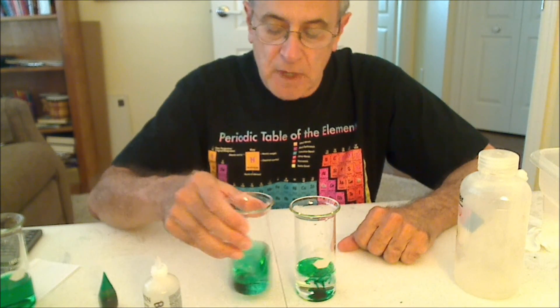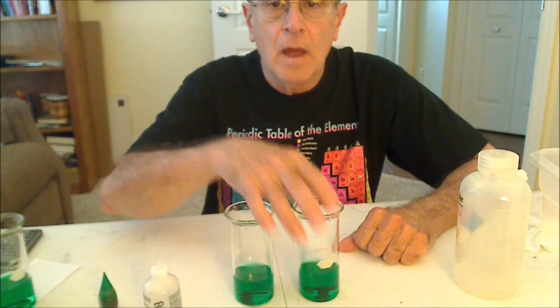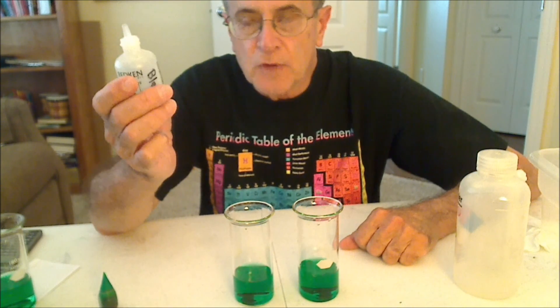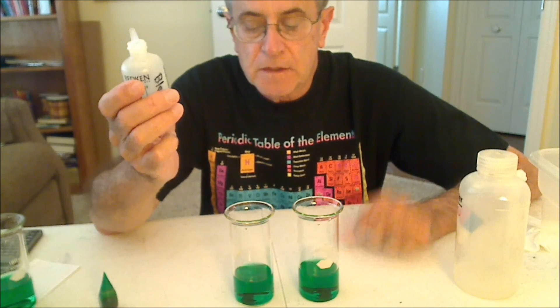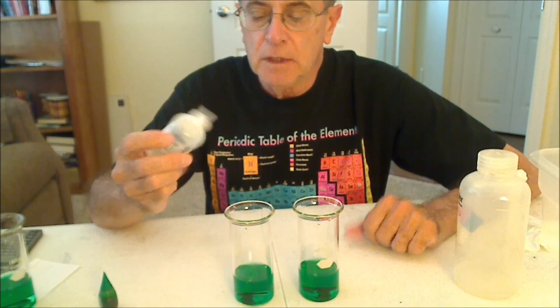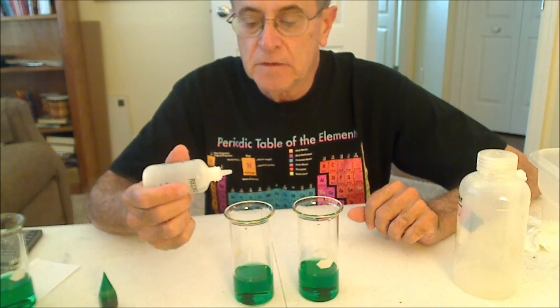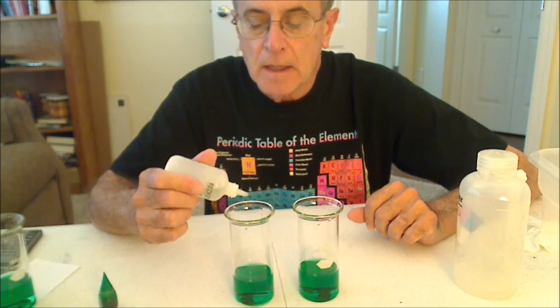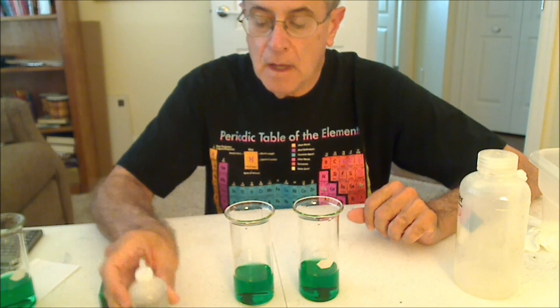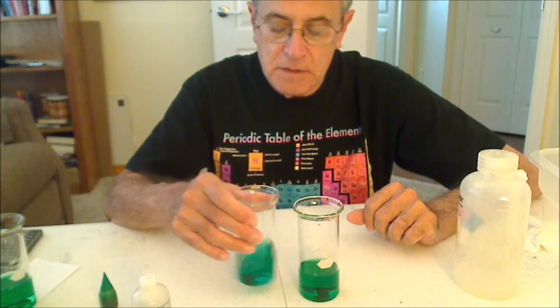Mix them up, and I'm going to add one drop of household bleach. This is just normal household bleach — I haven't diluted it. Be very careful, it's a very strong oxidant. I add the one drop and mix it up and see what happens.